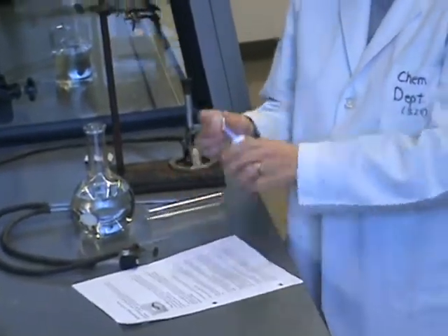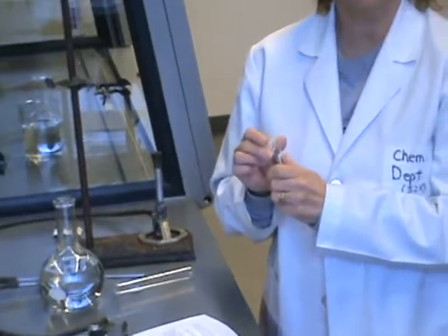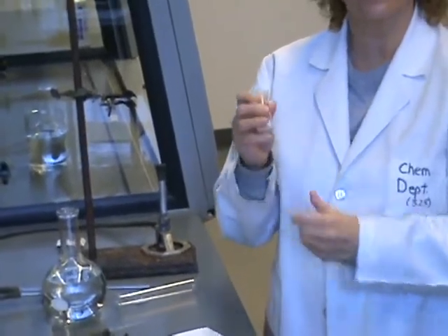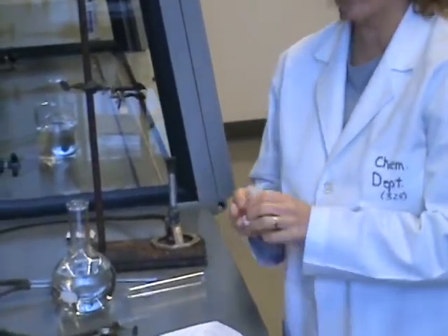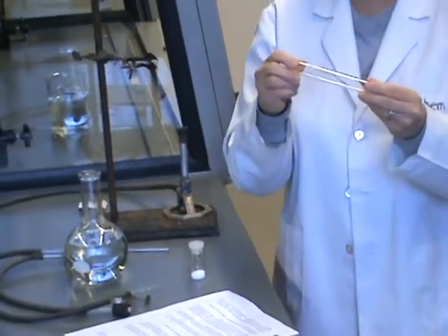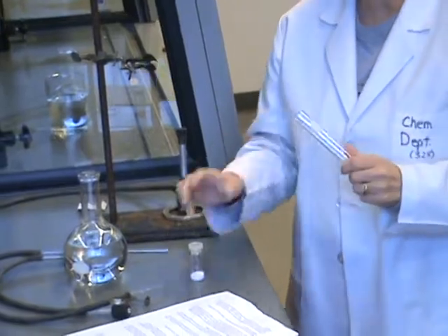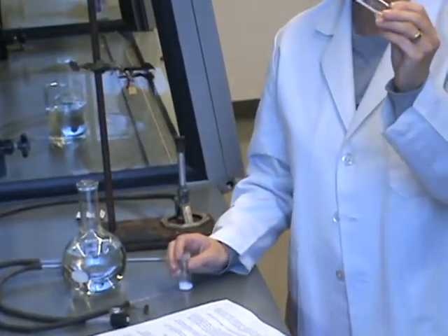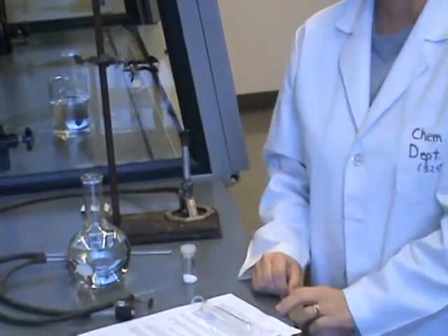When you go down to the storeroom, one of the things that you will receive is a vial with your chemical in it. First thing you want to do is weigh this chemical. So get a clean dry test tube out of your drawer and take it into the balance room. You need to weigh this while it's empty. Write that weight down.